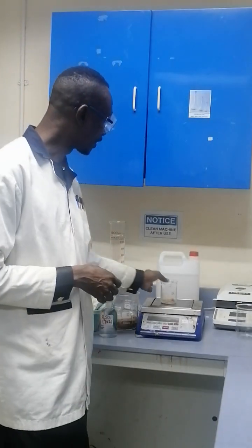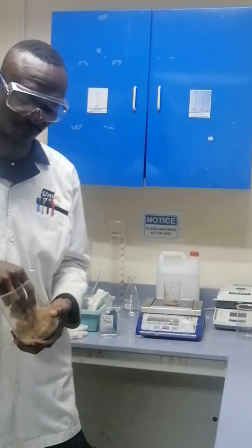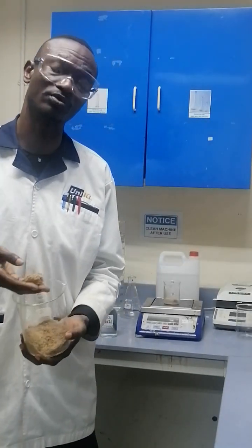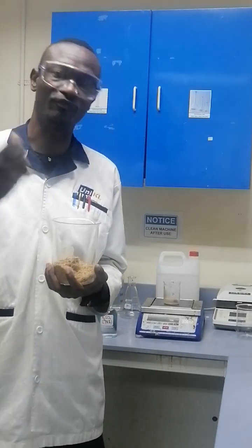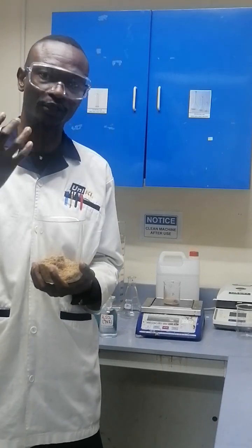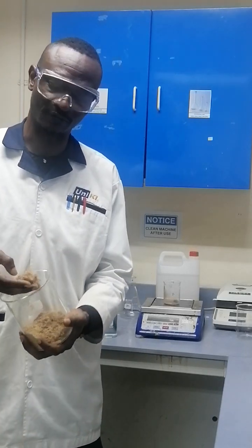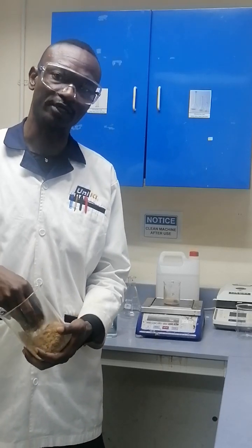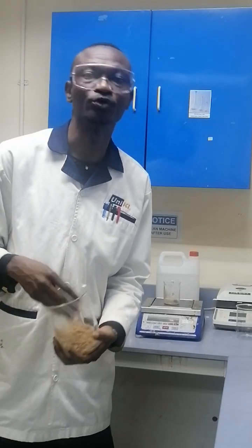Today we are faced with the task of extracting lignin from a plant biomass known as oil palm empty fruit bunch. This is the empty bunch that remains when the palm oil fruit is harvested and the fruits are removed for palm oil production. After grinding, it looks like this — ground to about 420 microns particle size.